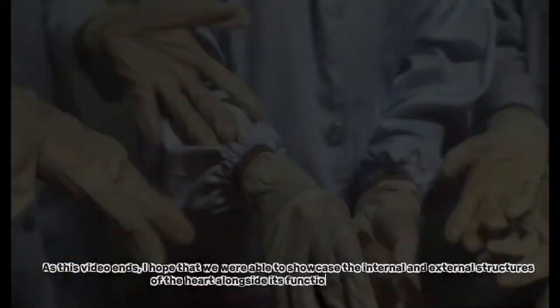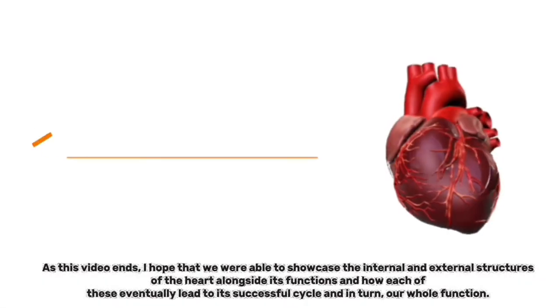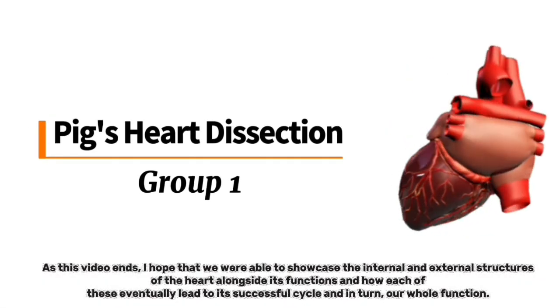As this video ends, I hope that we were able to showcase the internal and external structures of the heart, alongside its functions, and how each of these eventually leads to its successful cycle.